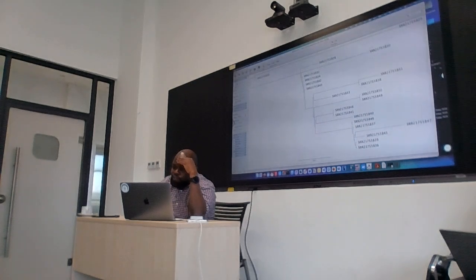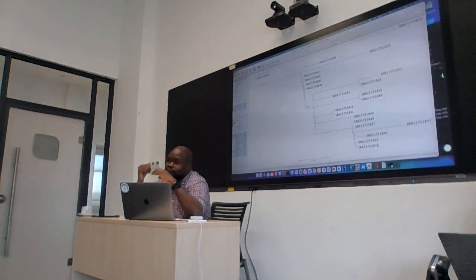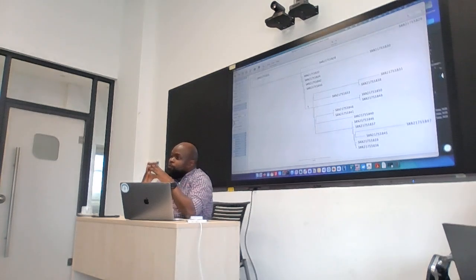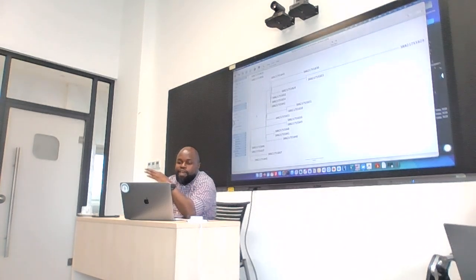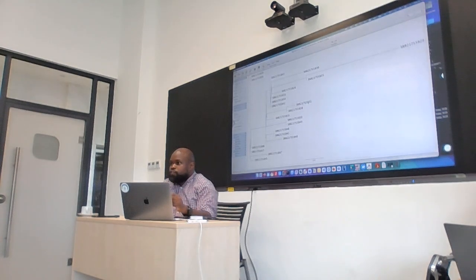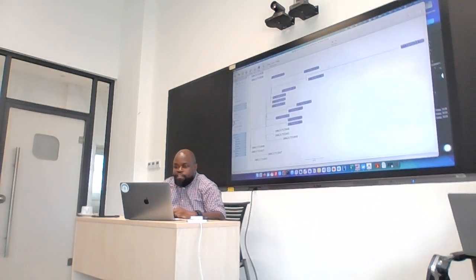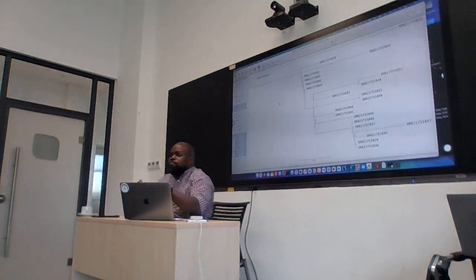You could say there appear to be two big clusters. There's this one that comprises two sequences and this upper one here, right? And even for this one, you can almost see some directionality. So that's why people often use midpoint rooting. Again, before you decide how you want to root your tree, this is why I say domain expertise is quite important, because you don't want to end up with the wrong interpretation of the tree. In the unrooted tree, clearly, I can also see that these two sequences are quite different from this other cluster of sequences, right? They cluster quite differently from the rest. So when I look at the midpoint rooted tree, it's not giving me anything different from that one. It's just that now it's better to visualize.